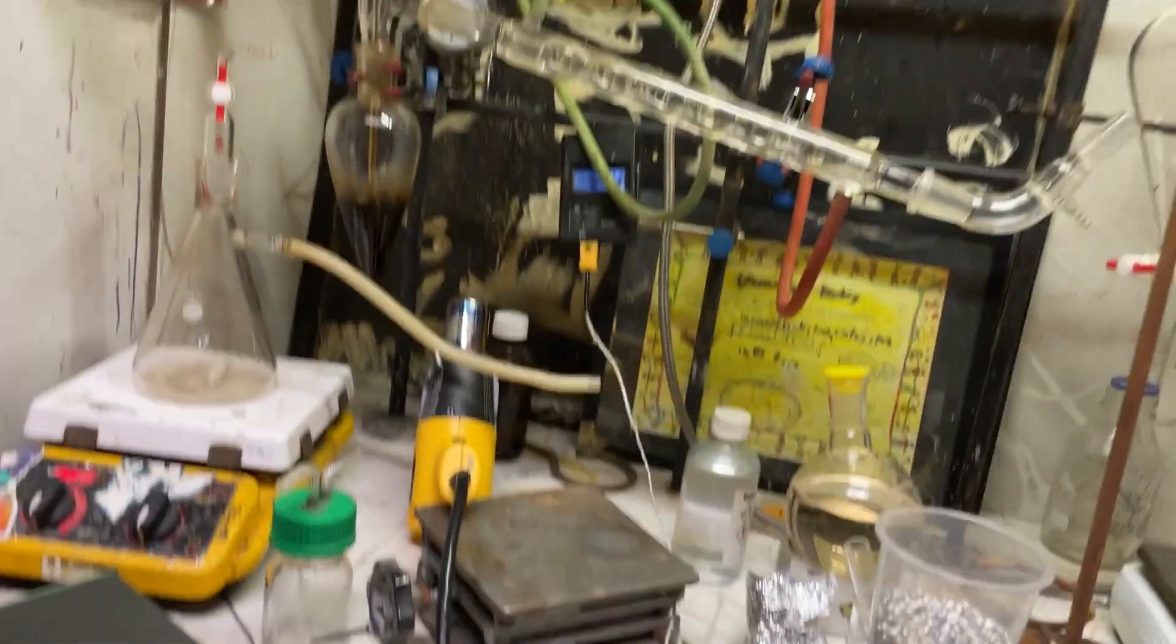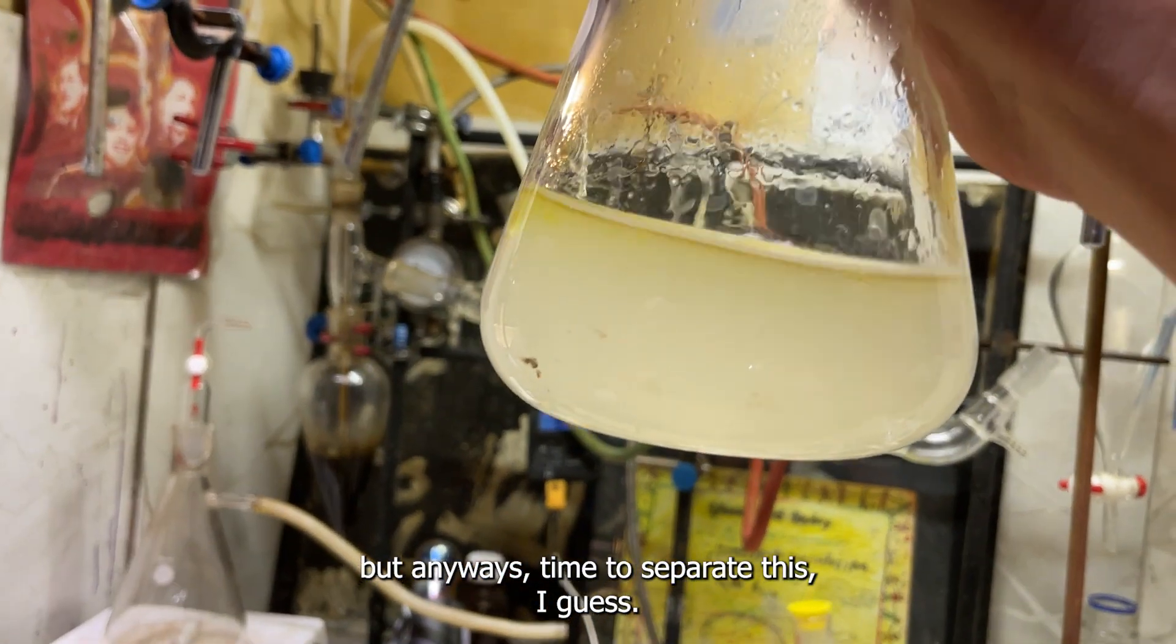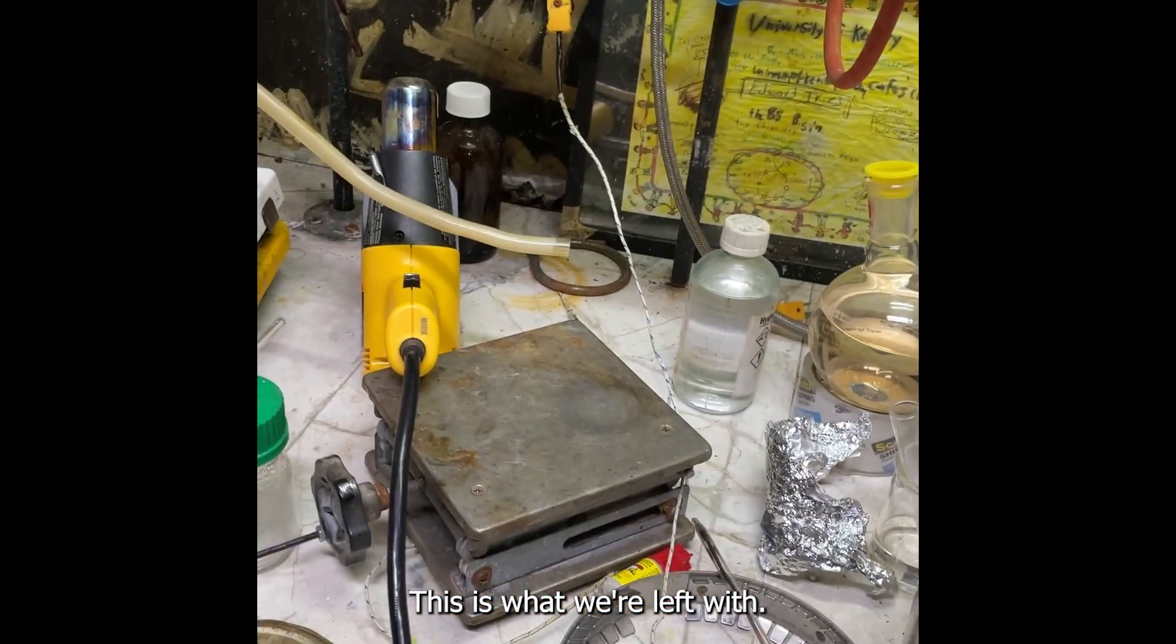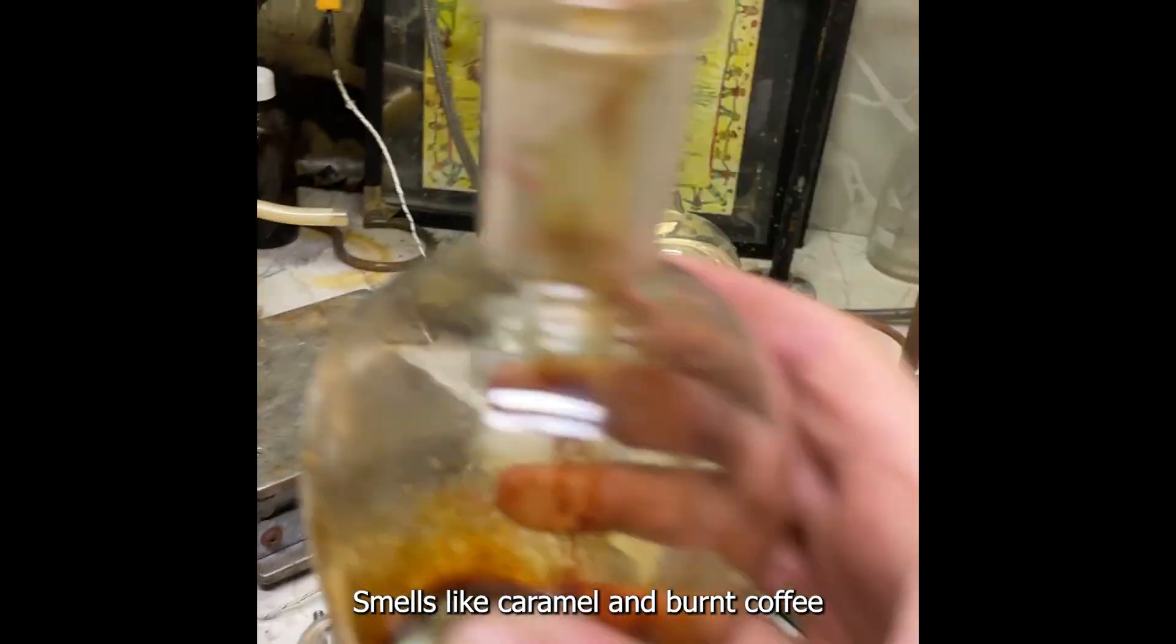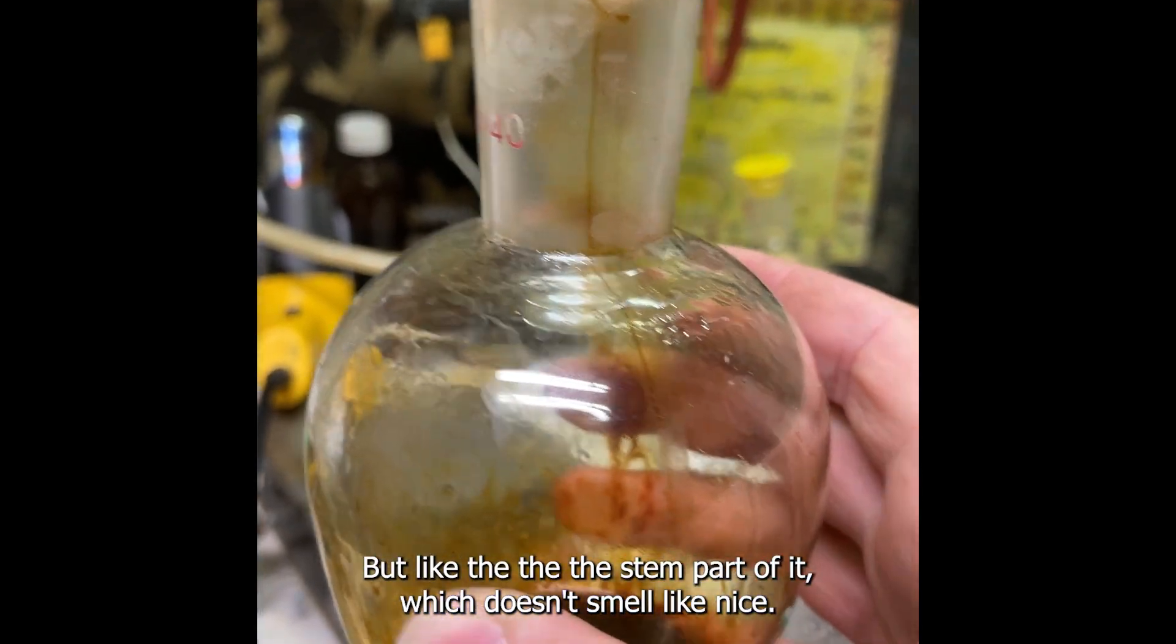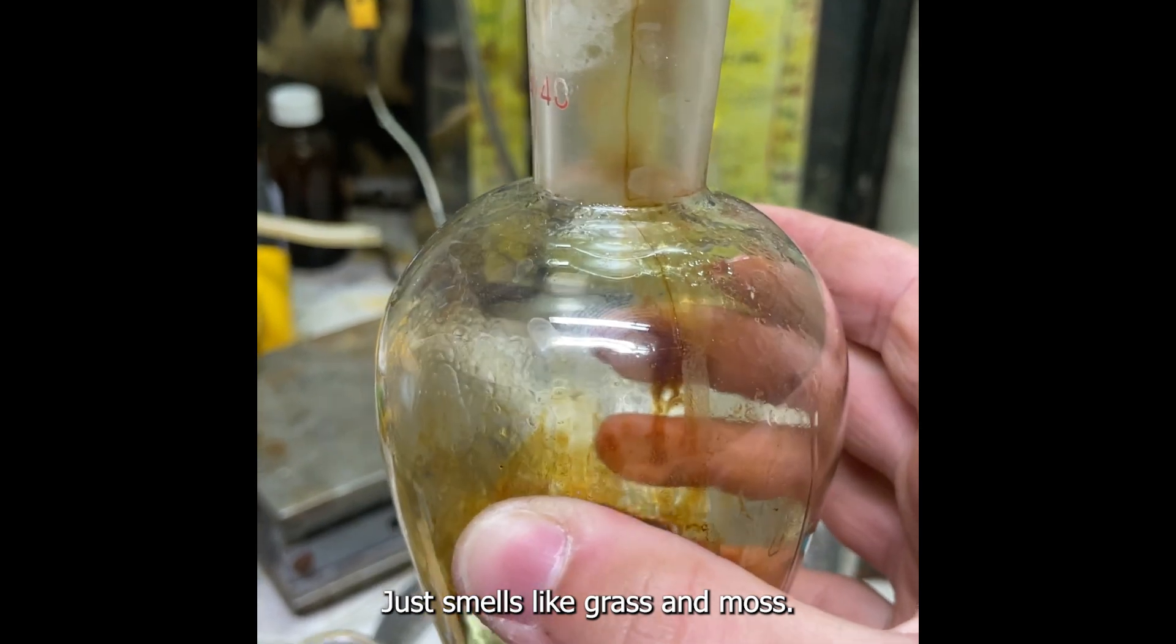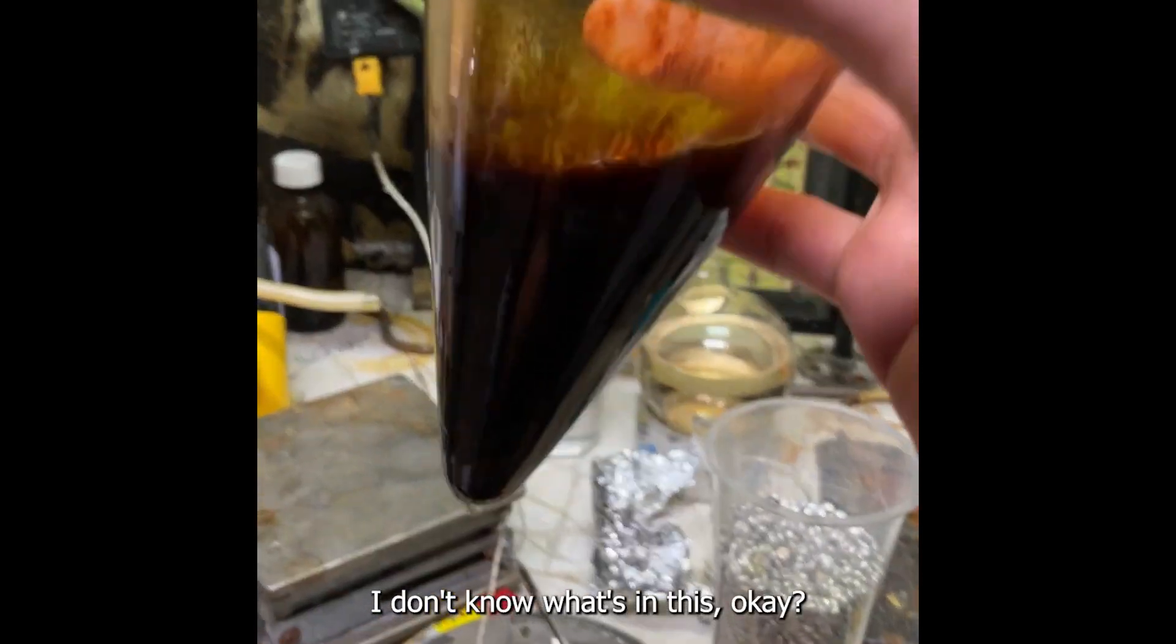This is what we're left with. It smells like caramel and burnt coffee and strawberries, but like the stem part of it which doesn't smell nice. It just smells like grass and moss. I don't know what's in this, it's just tar.